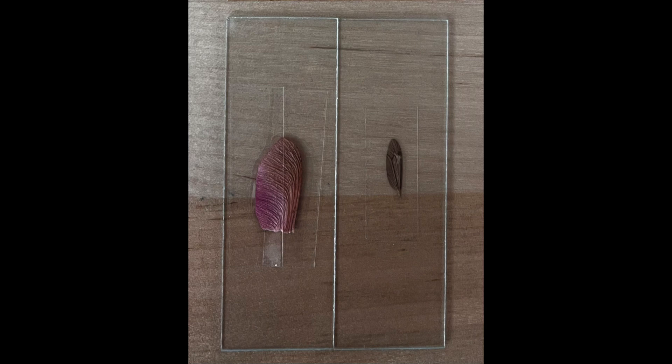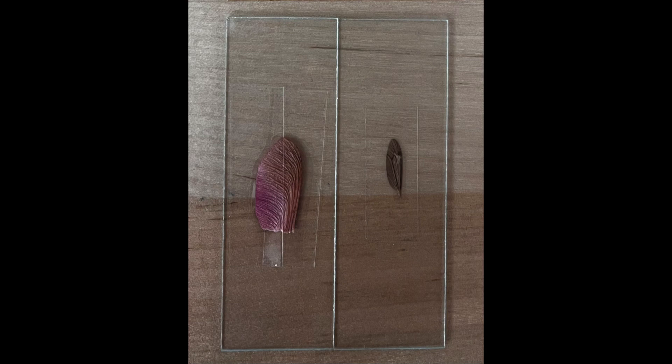It is fascinating how two such different organisms both use the same shape to help them fly, or float, from one place to another. The question remains: how similar are they on the microscopic level?